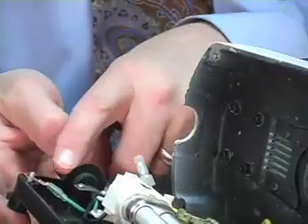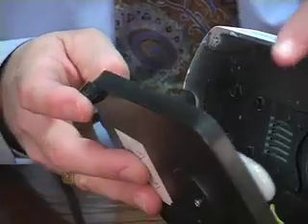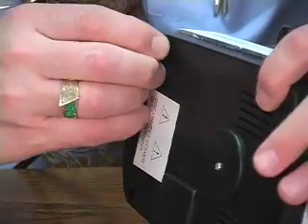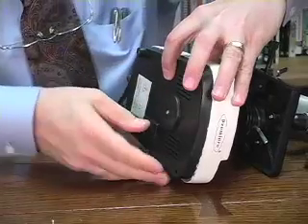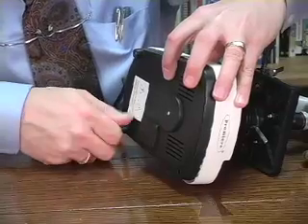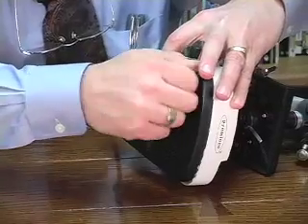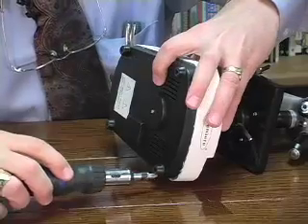You're going to want the little lip from the power cord to go inside the metal housing of the base. You're going to line it up, make sure all the wires are inside, not stuck anyplace. Once we get that started, don't finish screwing it all the way in. Just very light, finger tight. Get the other screws started, again using your fingers, and then we can finish with the screwdriver in a moment.